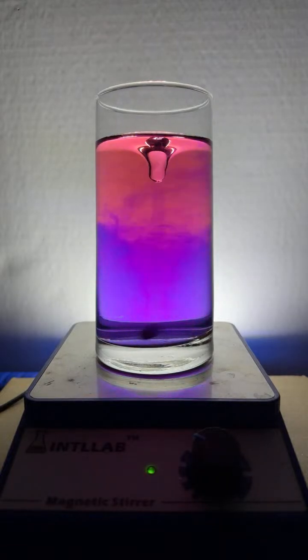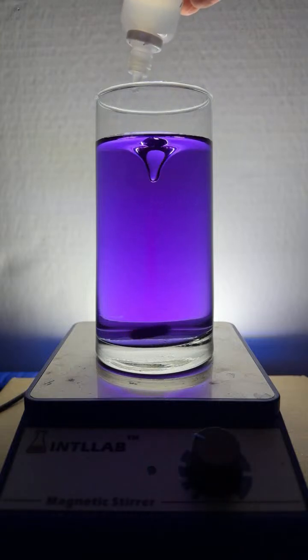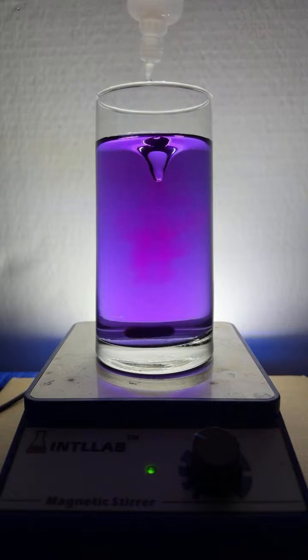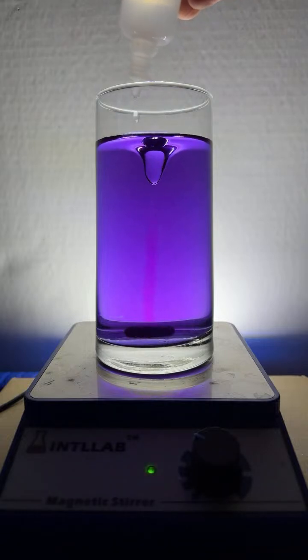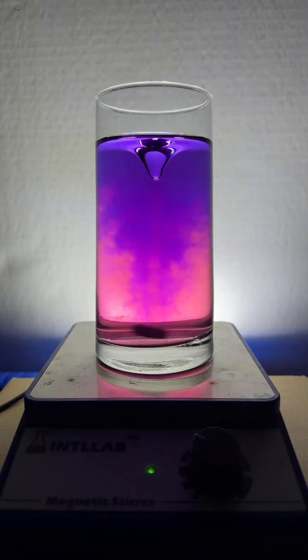That's a gorgeous color shift. Look at that. Really pretty. So it's working. It actually works with these household items. That's a nice violet. See if we can't get it to go to blue. Two more drops of base. That's cool. Carl Winslow, I got it. And let's add some acid, send it back in the other direction. Boy, that's pretty. Yeah, these work fairly nicely. What do you say we try some of the other natural food dyes? That's a pretty shift.